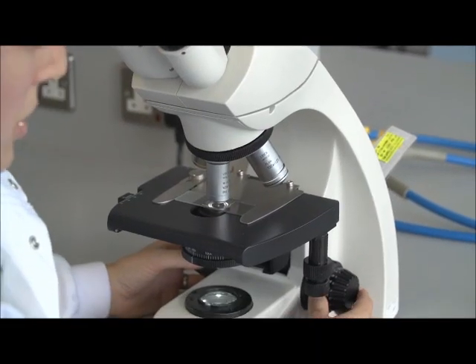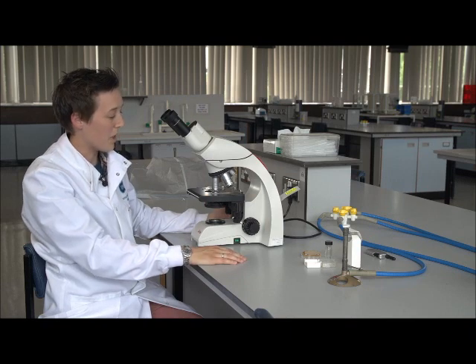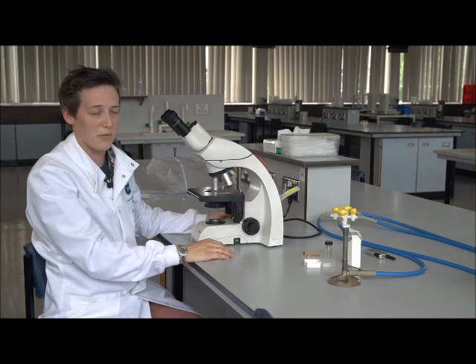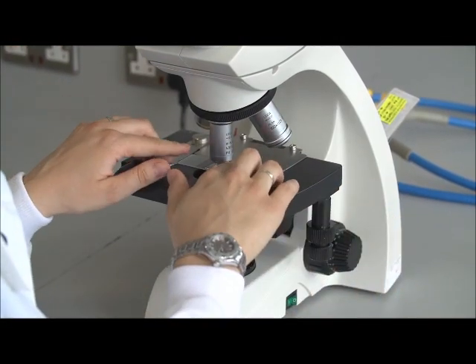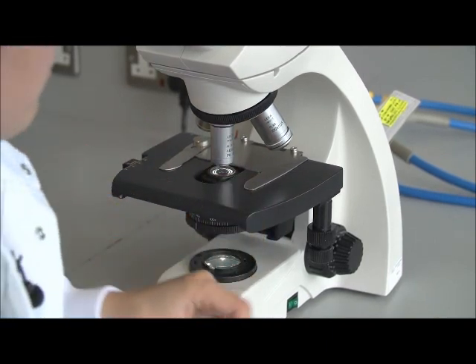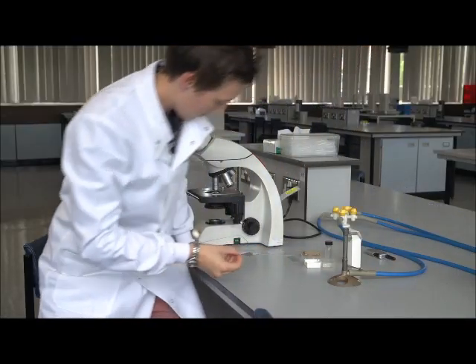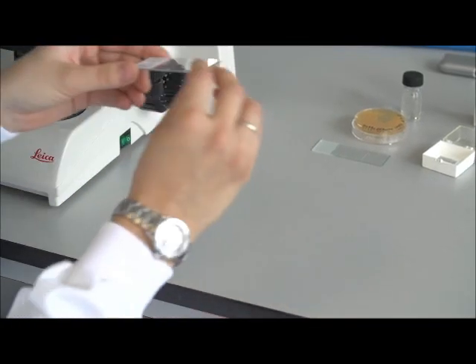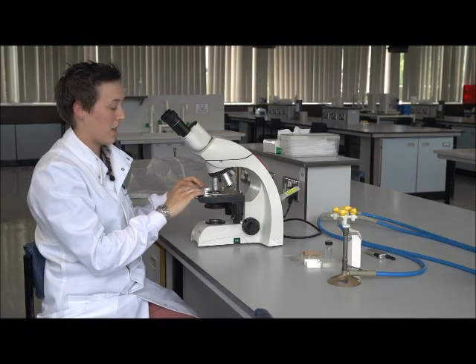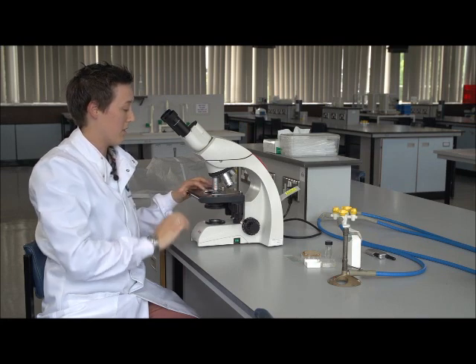What we can also look at is something a lot smaller, and that's something like a bacterial sample. So for bacteria, we would want to go up to 100 times. So what we can do is look at, for instance, a gram stain. And this is an example of a slide in which the cells have had to be killed and stained first before we can see them. And with the gram stain, we can see whether a particular bacterial pathogen is of gram-positive or gram-negative characteristic.